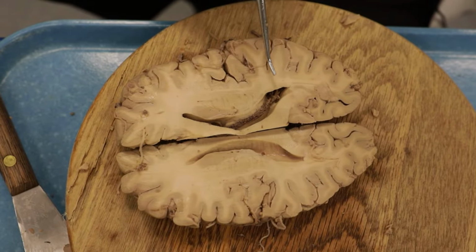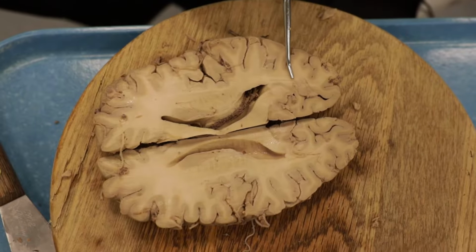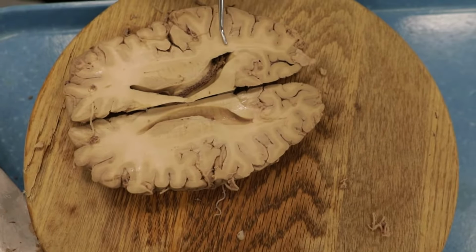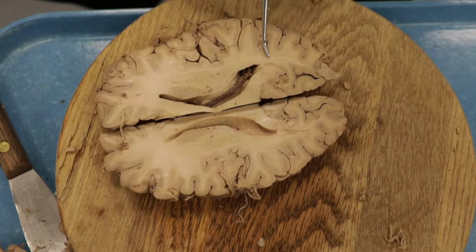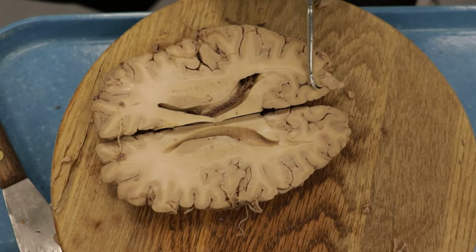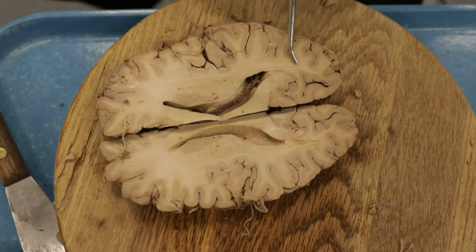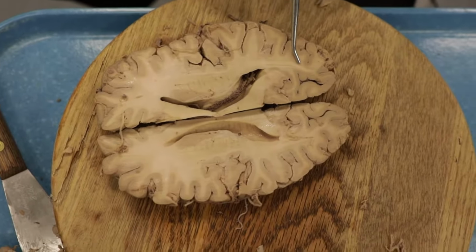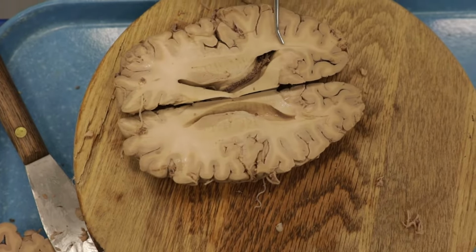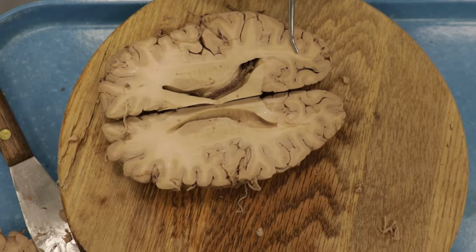All right. Now as we go back here, we can see there are some myelinated pathways traveling back to the occipital lobe. This is actually part of the optic radiations. Of course, we see with the back of the brain, and this is how vision gets to the occipital lobe, via the optic radiations. These optic radiations fan out over a large area from the temporal lobe to the parietal lobe. So we're just seeing the upper part of it right here.